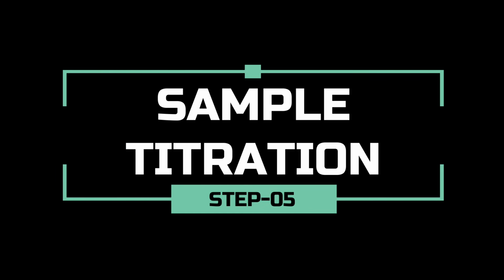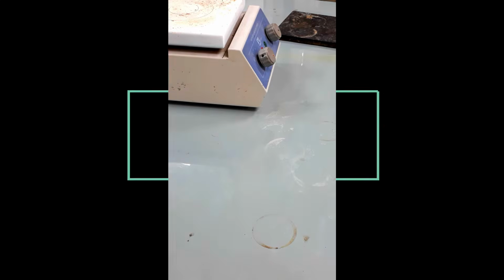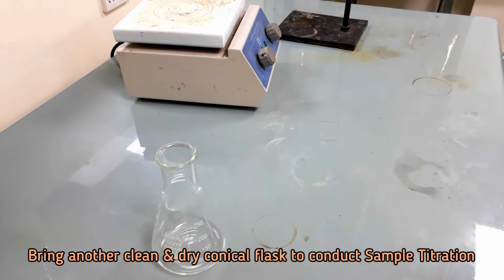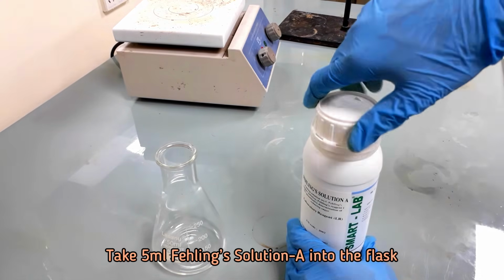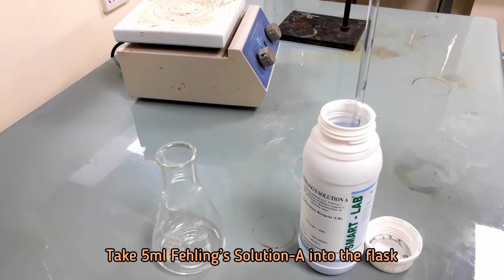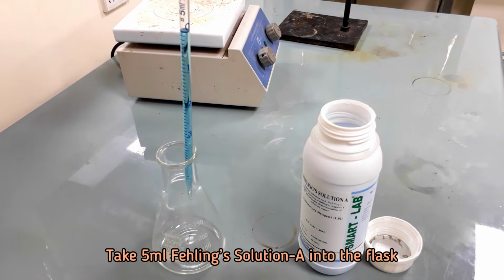Now we will carry out the sample titration. Take 5 ml Fehling solution A and 5 ml Fehling solution B into a conical flask.